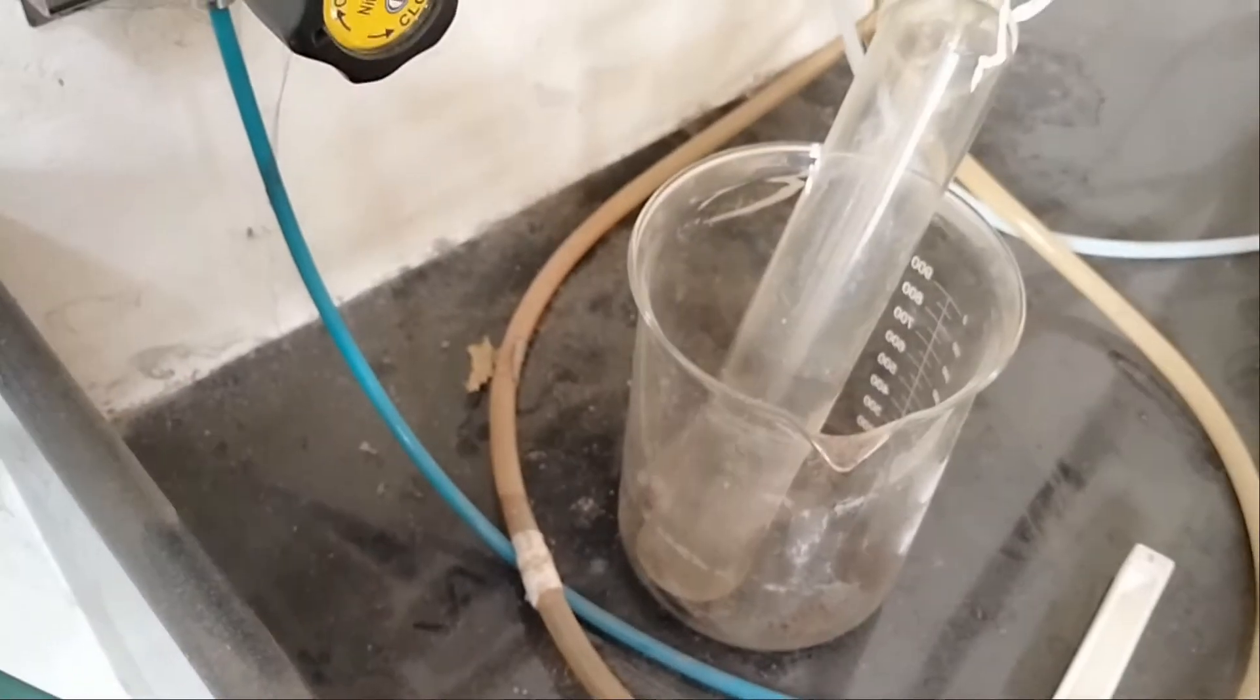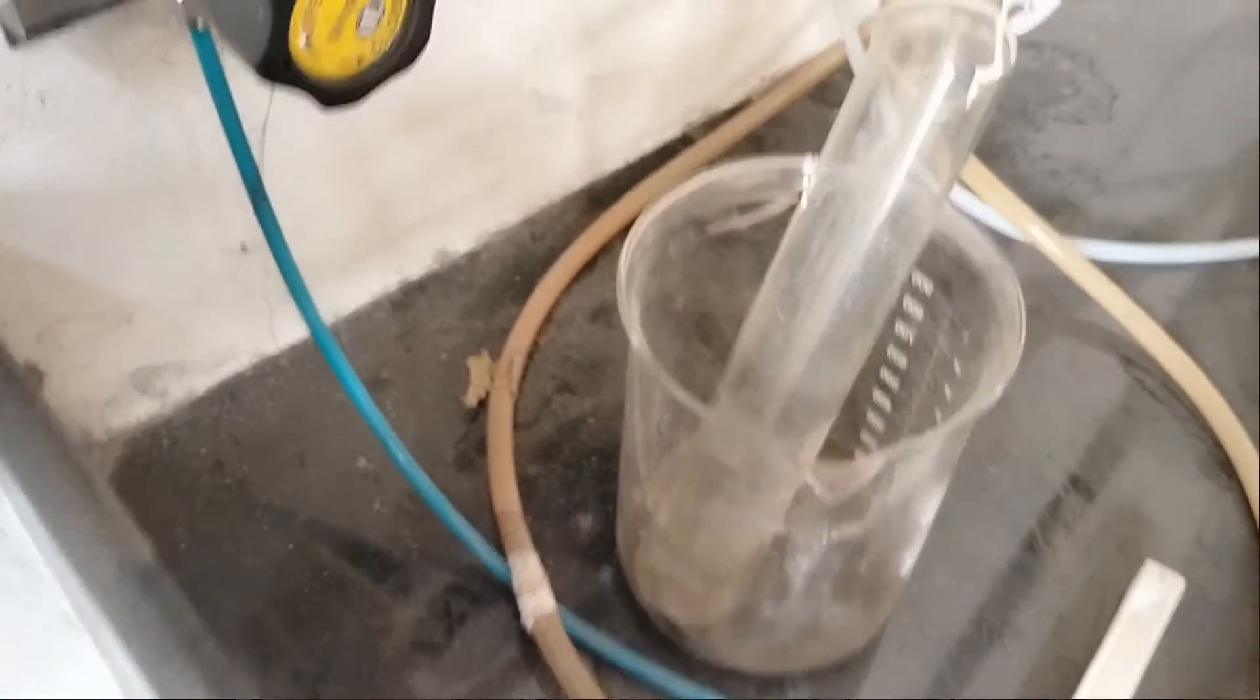In a tubular furnace, you can either do calcination under inert atmosphere or reduction using hydrogen gas. We will be using this tubular furnace for both uses. The flow of gas is tested using this particular sensor.